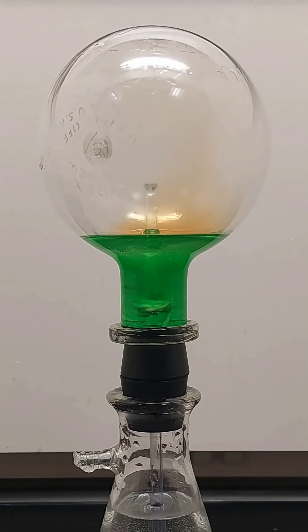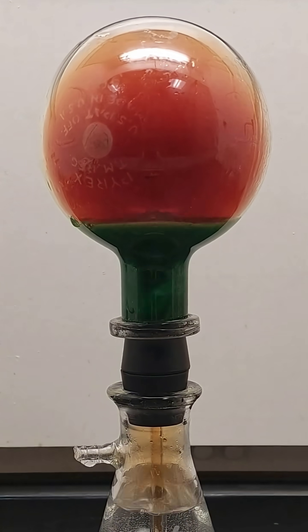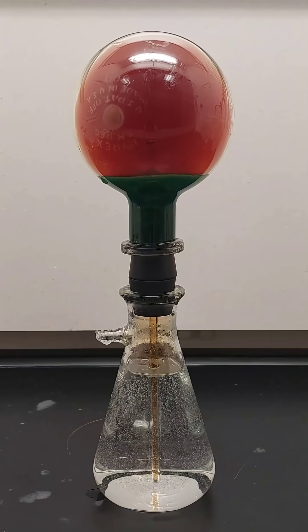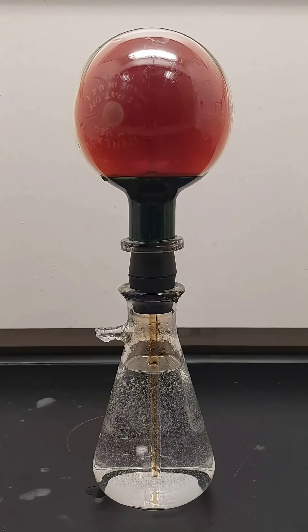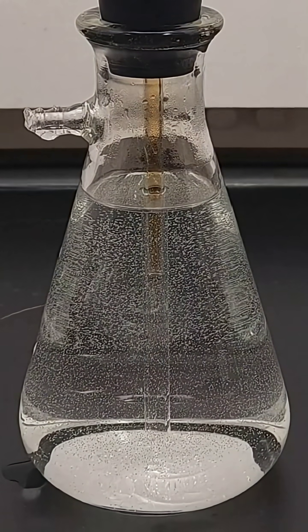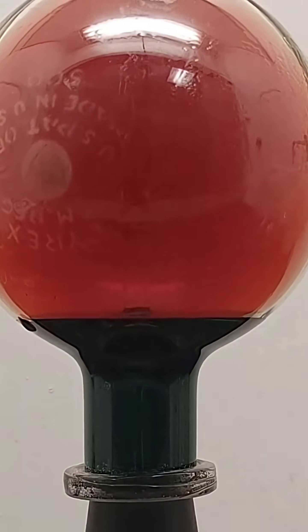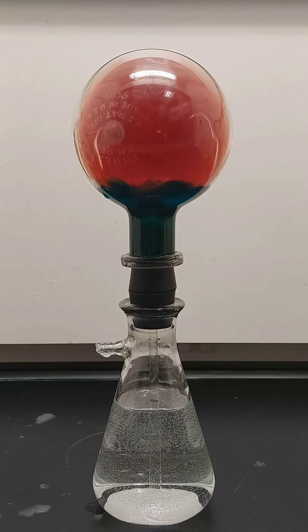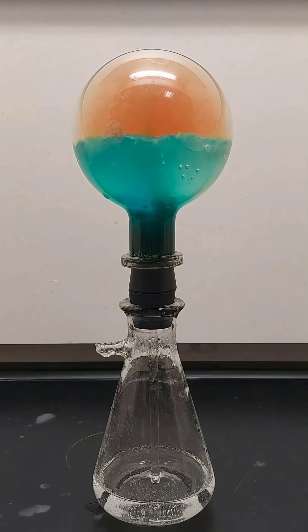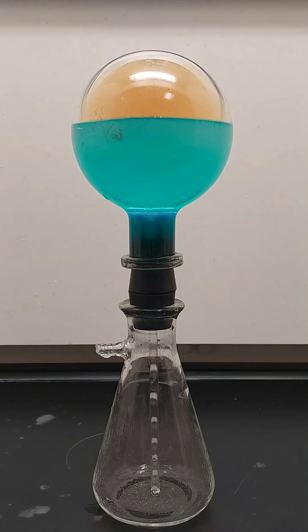Once the reaction slows, the nitrogen dioxide gas begins cooling and starts to become dissolved in the water, regenerating some nitric acid and causing the water to climb the tube. As the water reaches the top of the tube, the surface area available to absorb nitrogen dioxide increases and a positive feedback loop occurs, increasing the rate of absorption and causing the fountain, which then dilutes the copper nitrate to that beautiful sky blue.